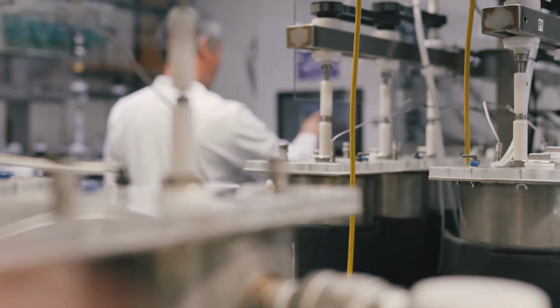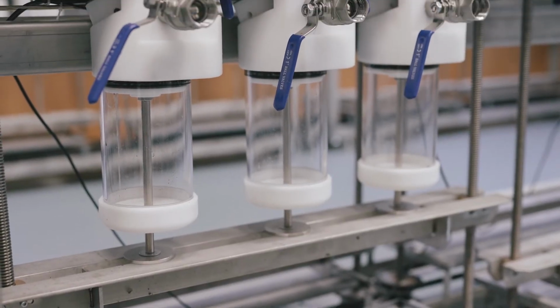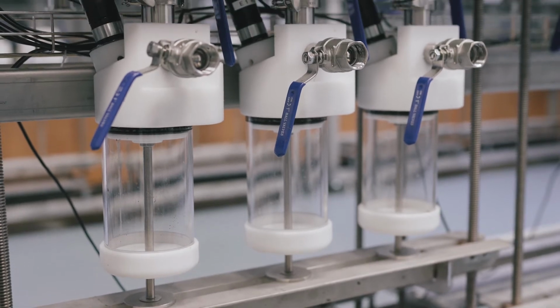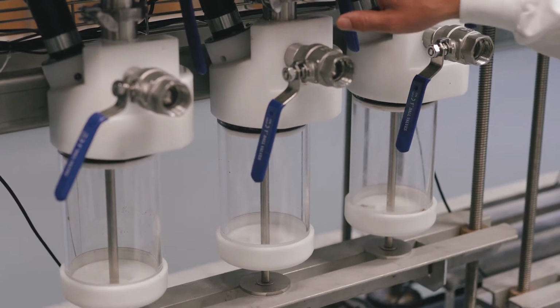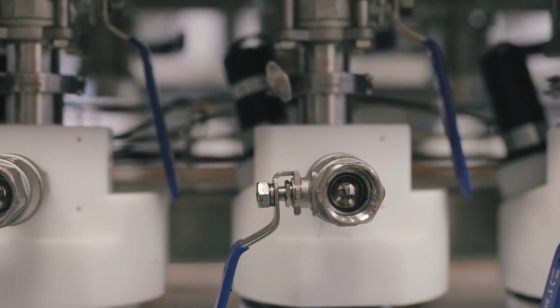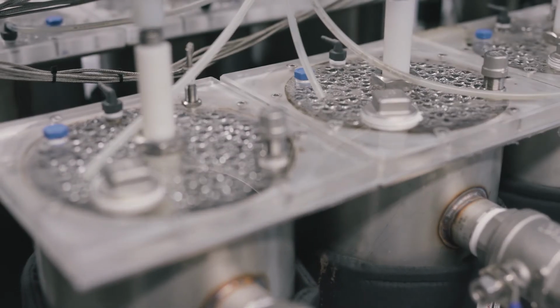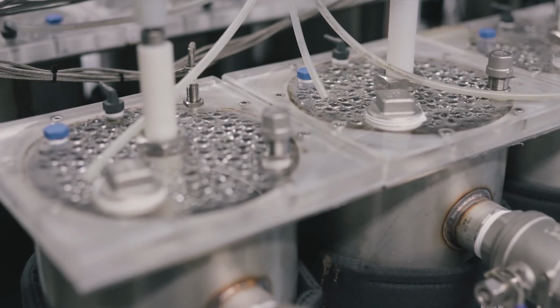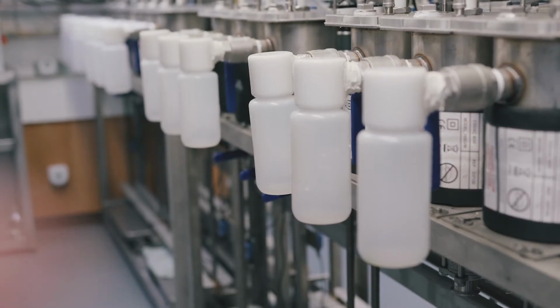The systems work in triplicate. Basically, we have what's called a feeder bar at the bottom. We load these syringes with the sludge that we want to feed into the system. The bar moves very slowly up. That pushes the material through a non-return valve here into the bottom of the vessel. The vessel is heated, so we can control the temperature. We can control the rate that we feed at and how frequently we feed at. The system is normally stirred.